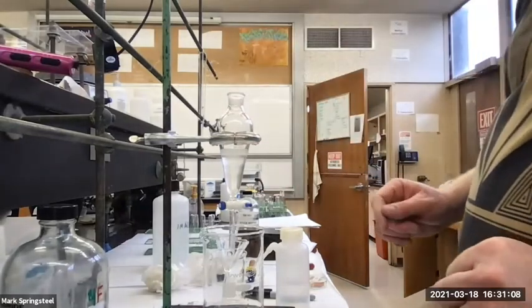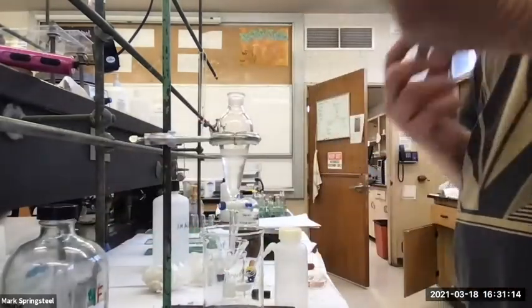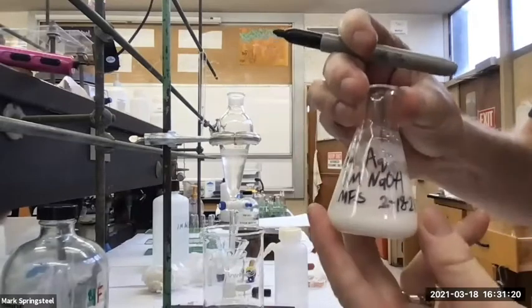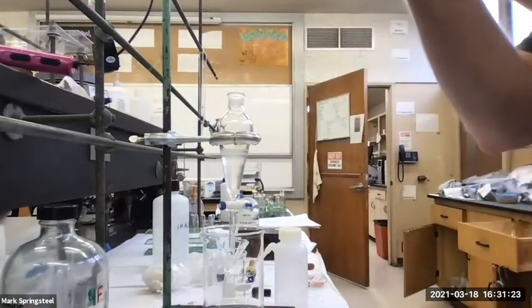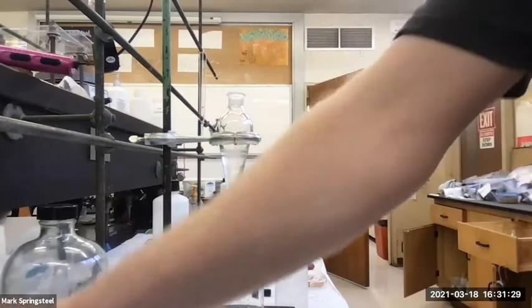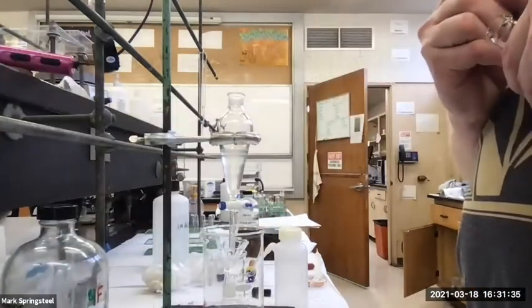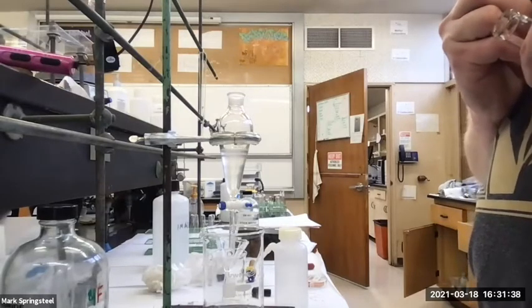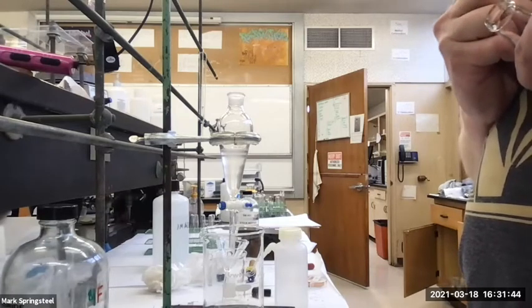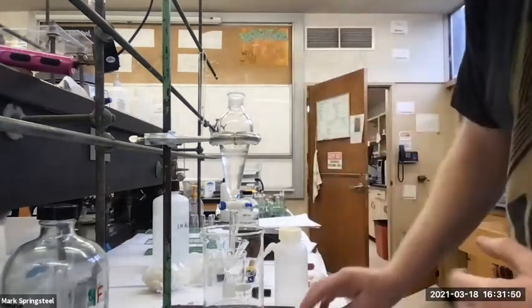Okay, and now this is going to be my second. That was the second aqueous, the last one. That was second aqueous, first sodium hydroxide. Oh wait, I should label this a little more. So I got second aqueous, first sodium hydroxide. I should say plus 6 molar HCl. Okay. Now I'm going to say third aqueous, and 1 molar NaOH. And this will be my initials, MFS 31821. Okay. Now I just need to drain it.